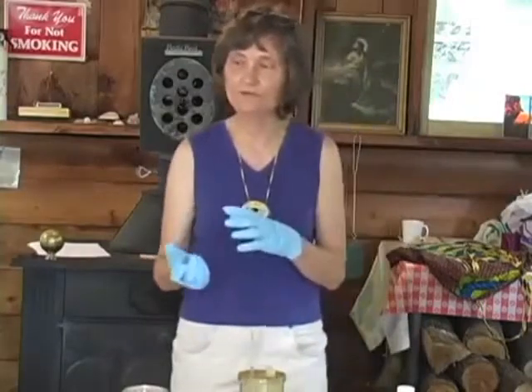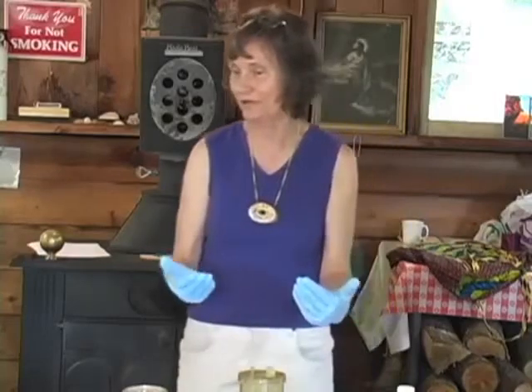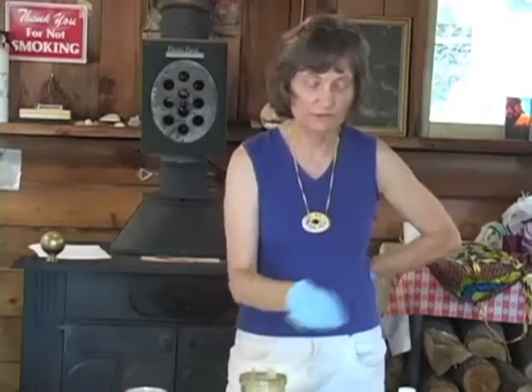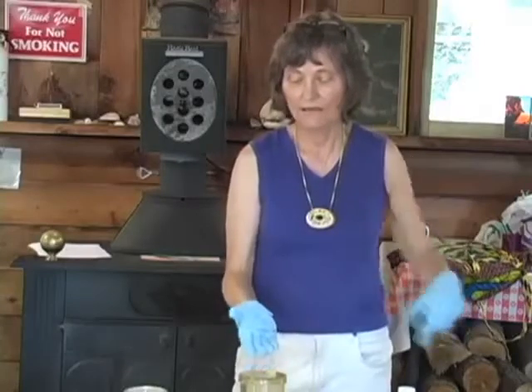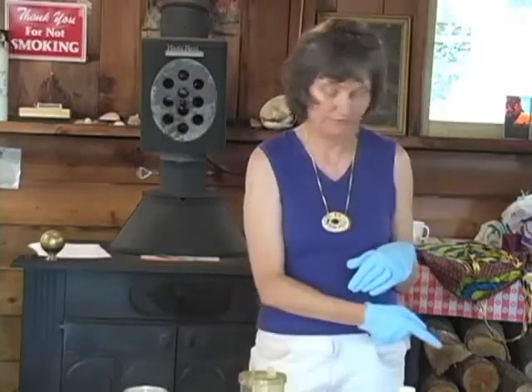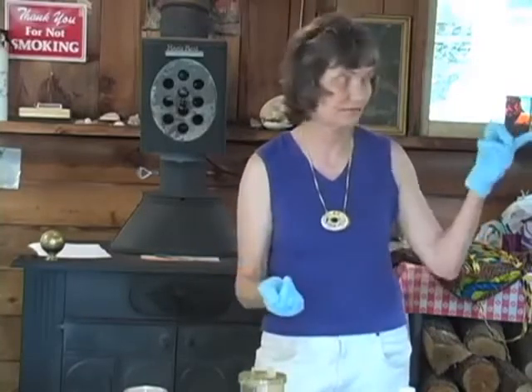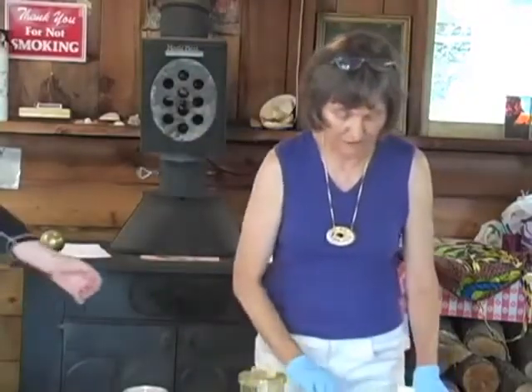And if you do, then you know your other results aren't totally right because you have introduced some bacteria. Now the problem today is that I have only one unit, so I'm going to run my blank first because that shouldn't contaminate my unit. All of our other units are used by teachers. Then I'll run one of our samples, and I can re-sterilize the top if people want to come back later. That'll take a few minutes on the stove. But the first thing we need to do, I'm going to have David read the directions nice and loud because he has the loud voice.